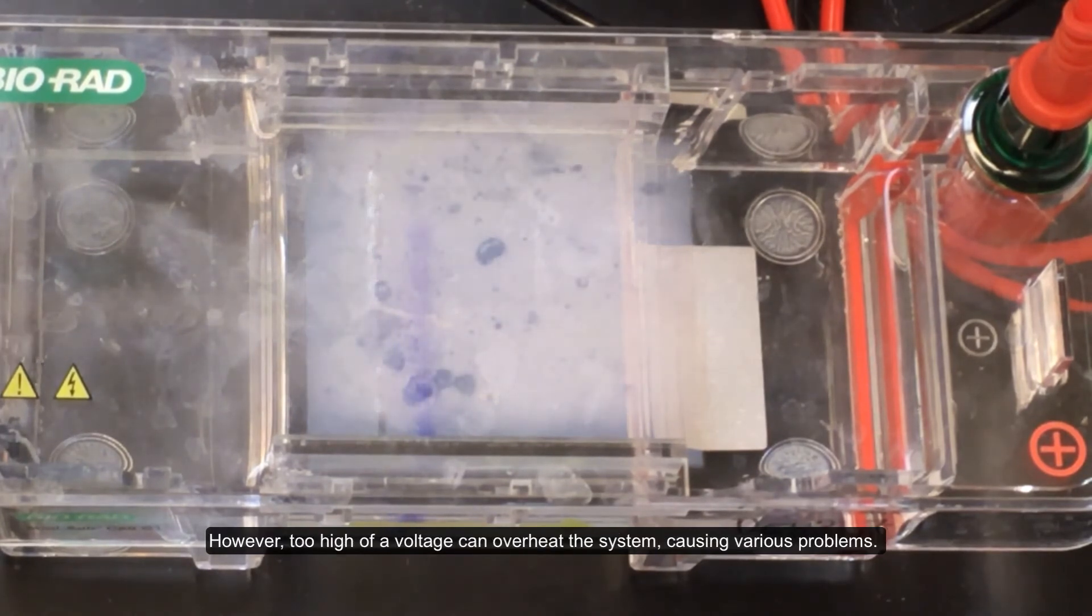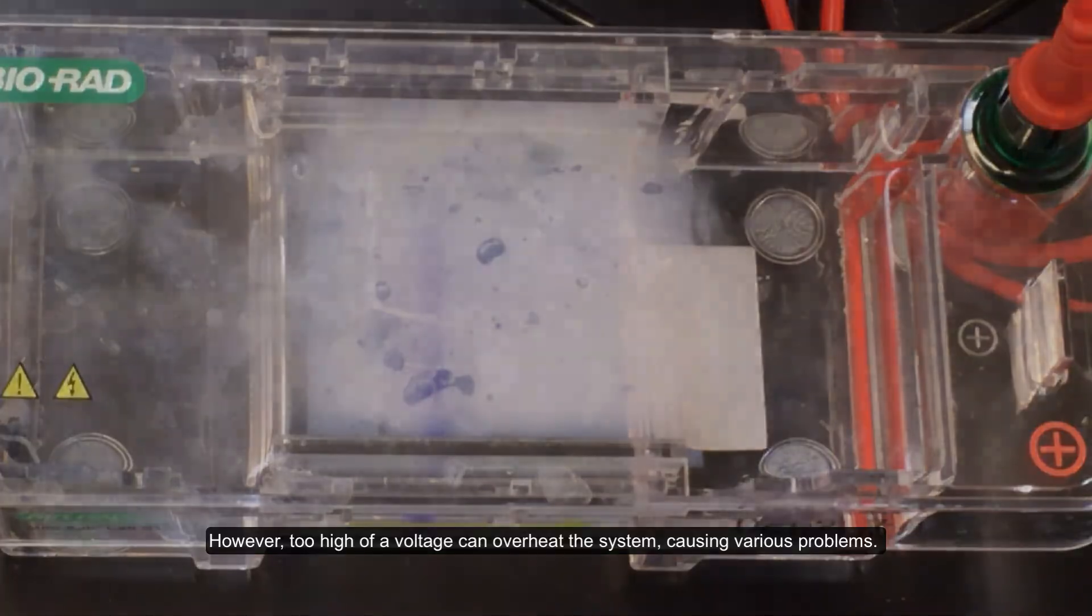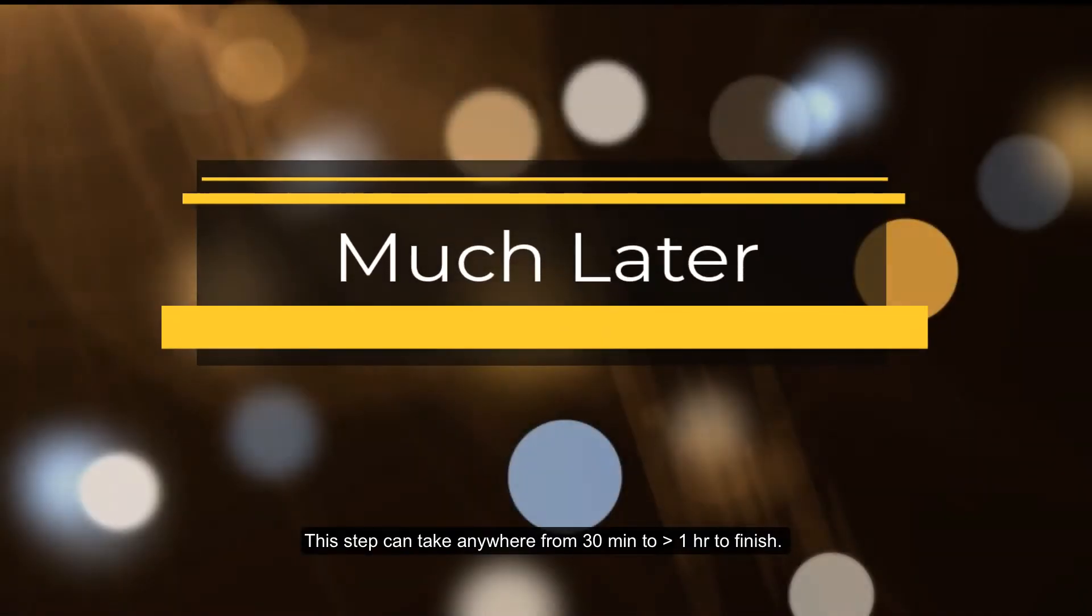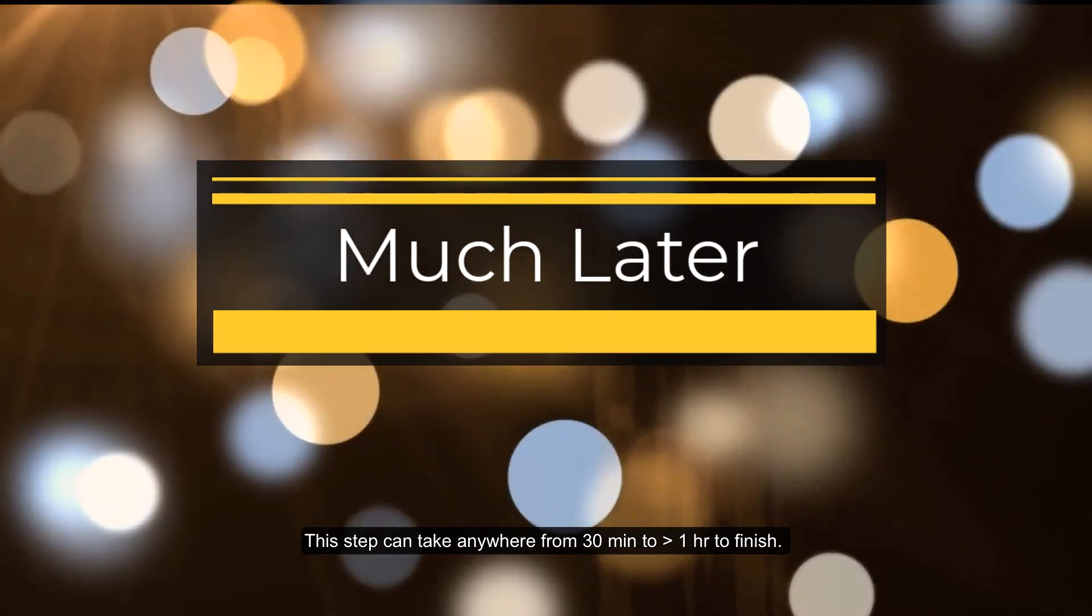However, too high of a voltage can overheat the system, causing various problems. Shorter gels also have less separation between bands. This step can take anywhere from 30 minutes to over one hour to finish.